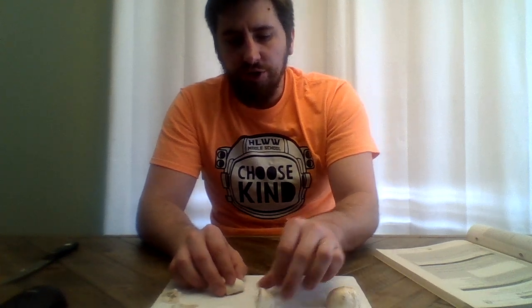Okay, so we've talked about three main structures and their functions: cap, stem, and gills. And hopefully this helped you learn a little bit more about mushrooms, which is one of the main fungi, and a little bit about their structures and how their structures help them function. Because the way that this is built helps it survive. If the structures were different in major ways, then they would be living a completely different life. So it's important to remember that the structure of a living thing determines the function of it, right?